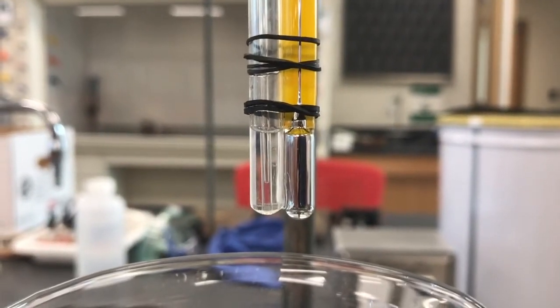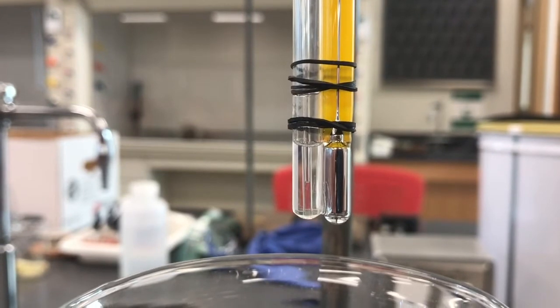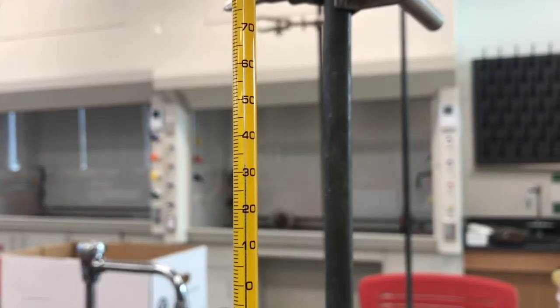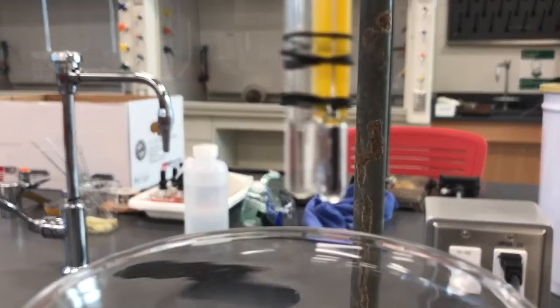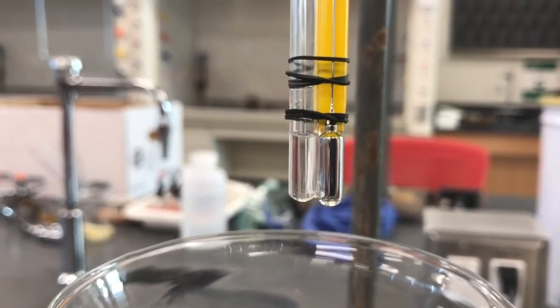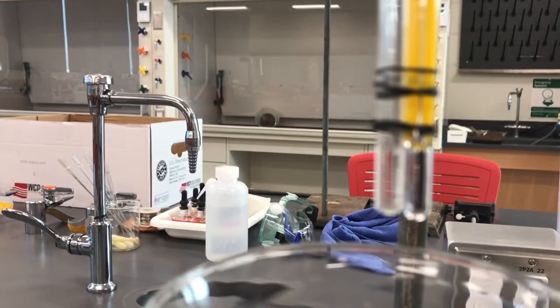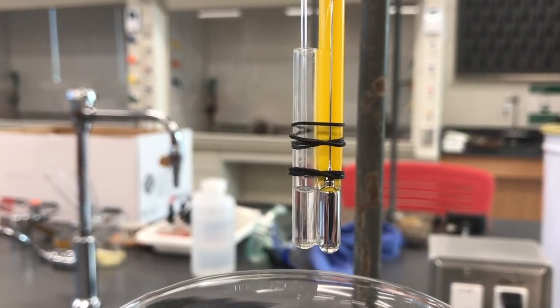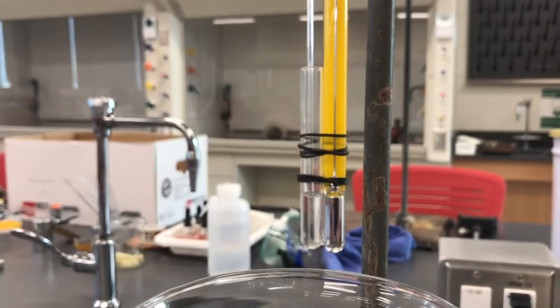You can just start to see the pentane getting sucked up in there. It actually cooled pretty fast, so if I really cared about this, I'd try to do it a little more carefully the next couple of times. If I really cared about this, I definitely would have slowed down the cooling. You can see how quickly this thing cools. But as it's cooling, there's a little bit more of a vacuum produced in that single-end sealed tube. You can see it even go farther and farther up the tube as we wait here. Tell me that's not exciting.